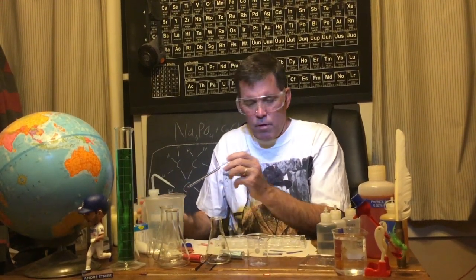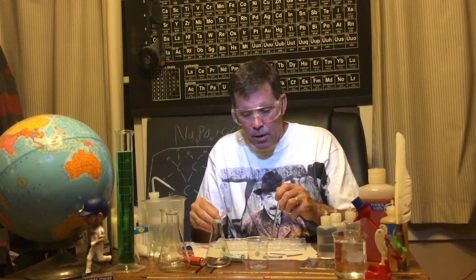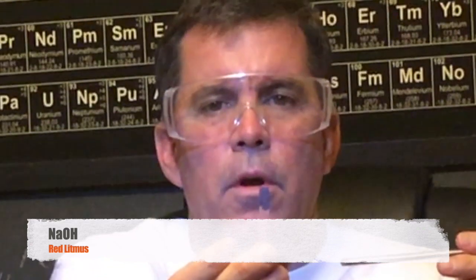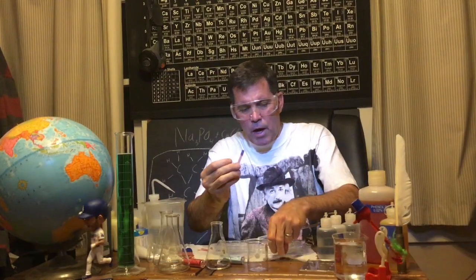Yeah, you're probably thinking this is not very interesting. Well, let's try the strong base. Look at that. What happens to the litmus paper in basic solution? It goes back to this color.